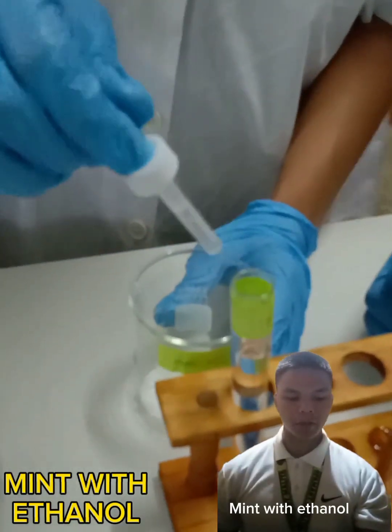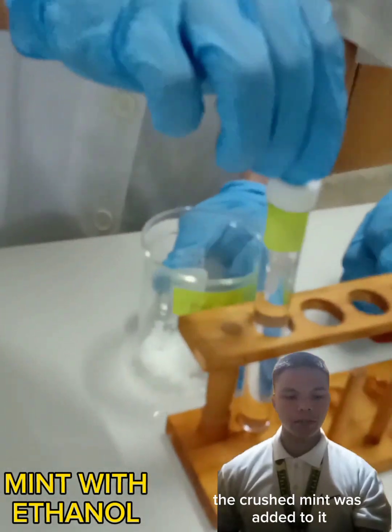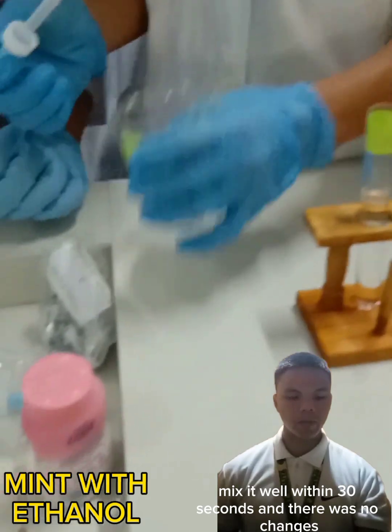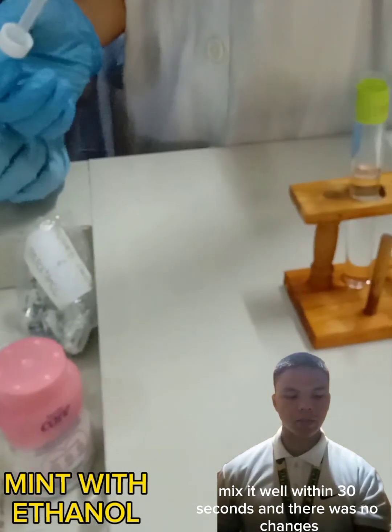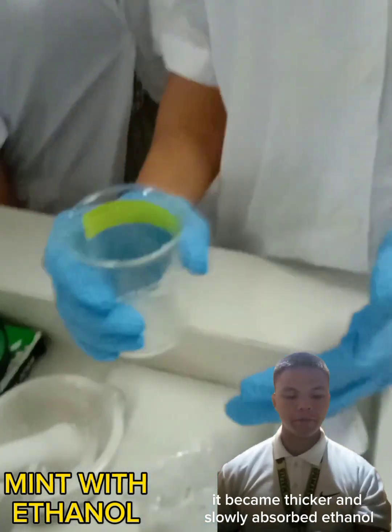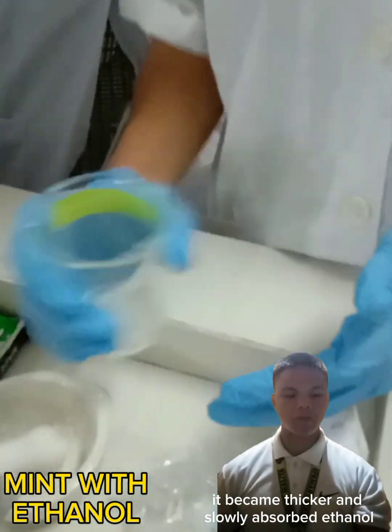Mint with ethanol. The crushed mint was added along with 7 drops of ethanol. Mix it well within 30 seconds and there were no changes. When we mixed it again within 1 minute, it became thicker and slowly absorbed the ethanol.